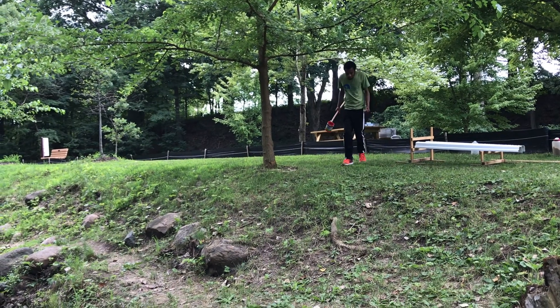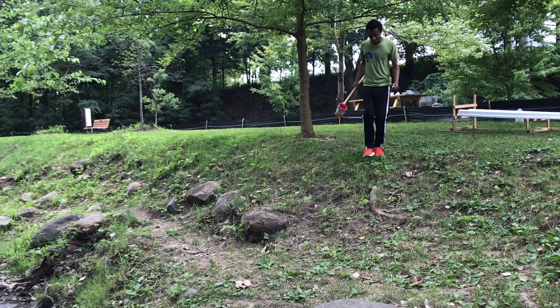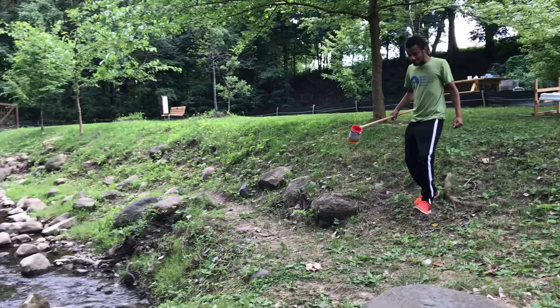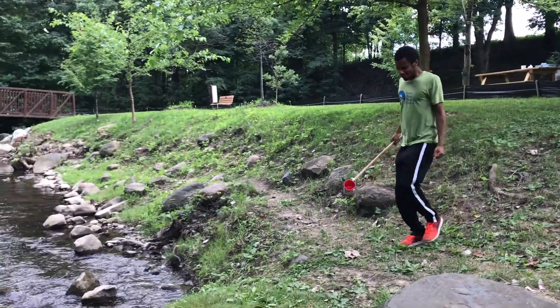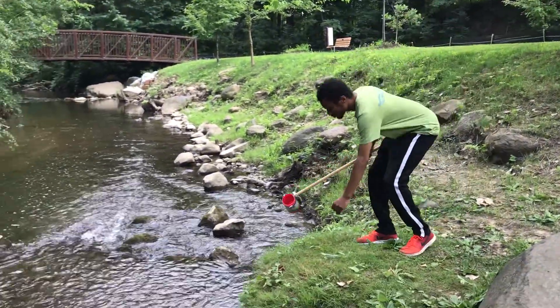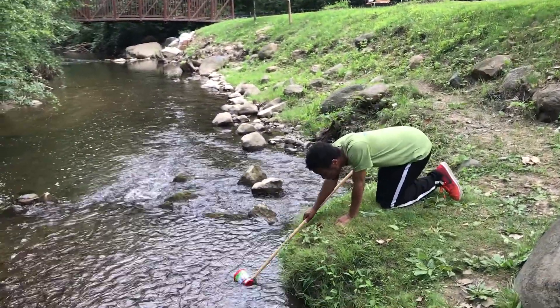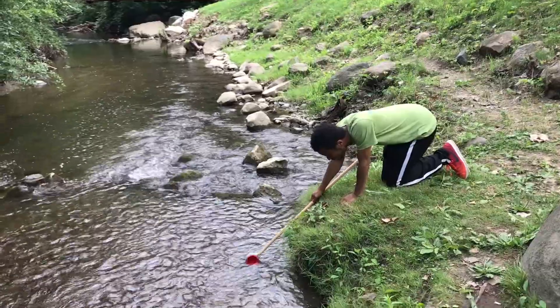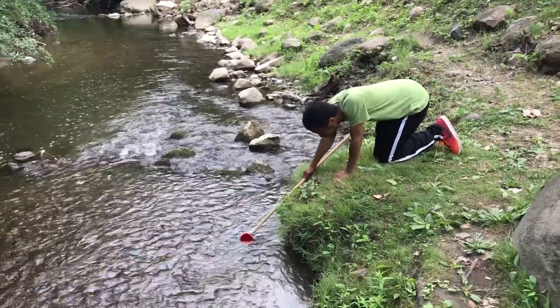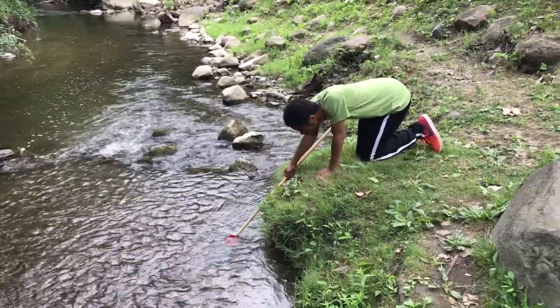Quentin is collecting water to test it for dissolved oxygen. We breathe oxygen from the air, but water organisms use oxygen that's dissolved in the water. The amount of dissolved oxygen, or DO, in water can vary.